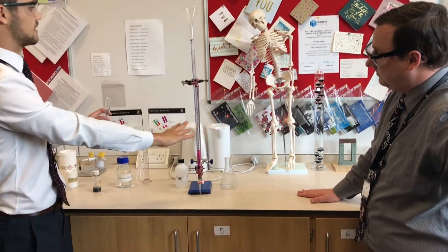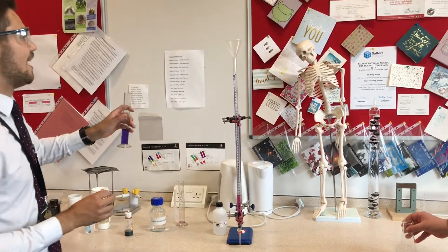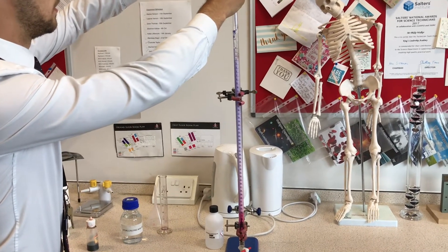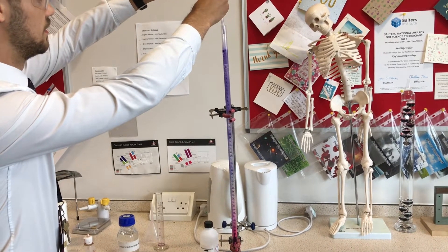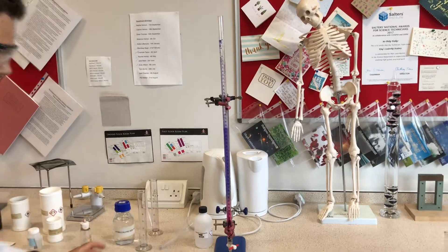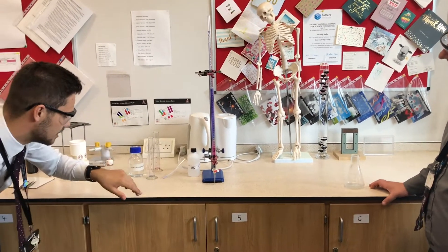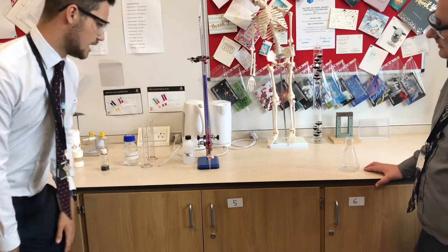Have a watch here — you'll see what's about to happen as I add this. Now I need to be careful because we will see a bit of effervescence, so just watching as I add these two solutions to one another. That is a lot of effervescence — or bubbling, to the lay people watching. And you can see here a band of blue and then red at the bottom, so we've still got two very distinct areas.